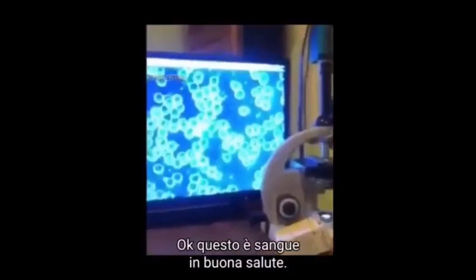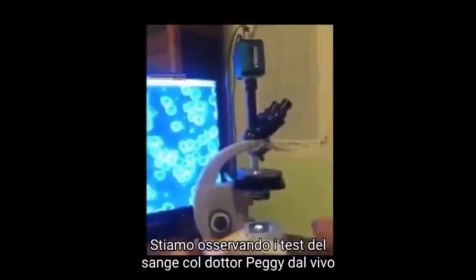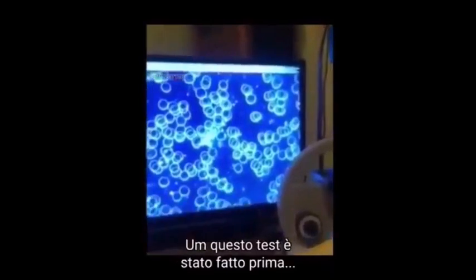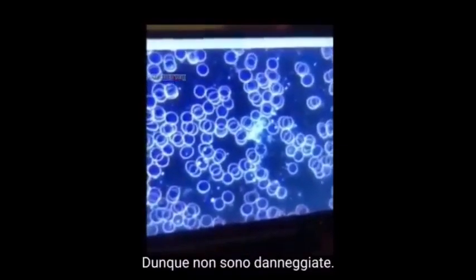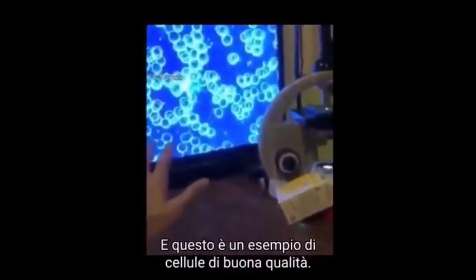Okay. And this is healthy blood, right? Yeah. So we're testing it live. We're testing Dr. Peggy's blood live. And what we can see is less aggregation. This was tested a while ago, right? This was put under a while ago. And we're seeing the quality of the blood cell intact. So it's not damaged, it's good quality blood cells. Yeah, absolutely. And this is an example of good blood cells, okay?